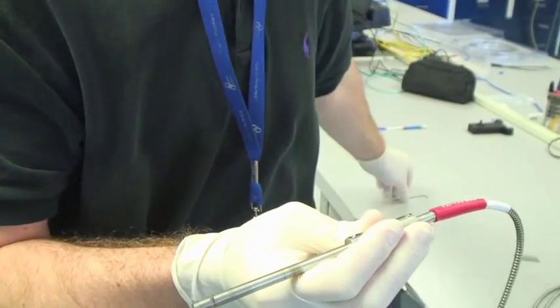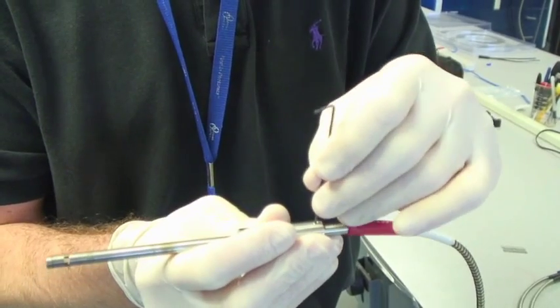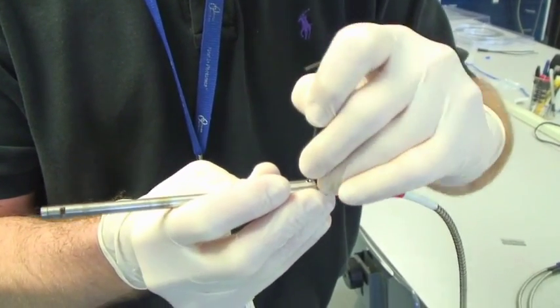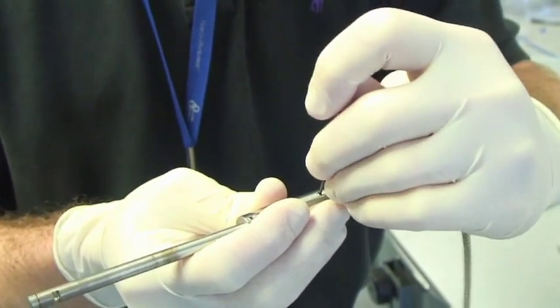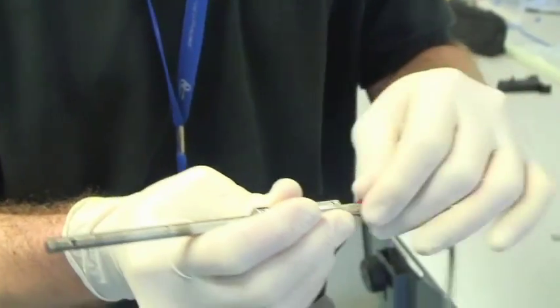So you can just get it in there and then using the allen key, secure the set screw like so. So that's good and tight. That's not going anywhere.